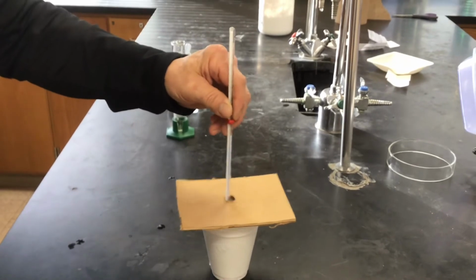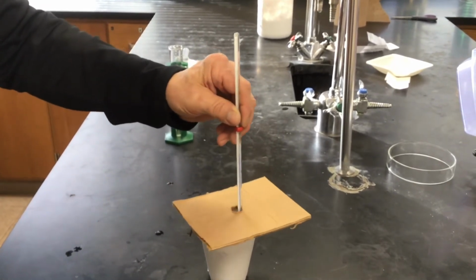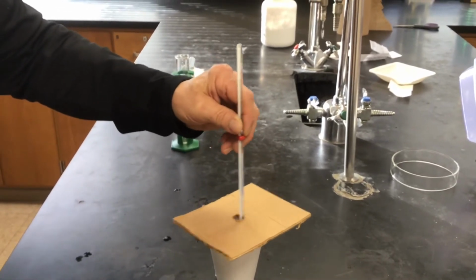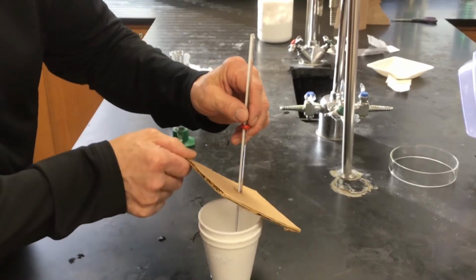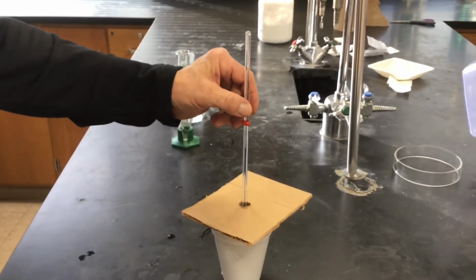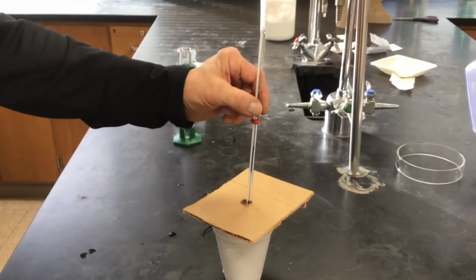Mr. Helvel's doing some gentle stirring in there just to keep that heat distributed evenly throughout the water. If you don't stir it, you can actually get hot spots in there. The bottom might be warmer, the top might be warmer, and you want it to be consistently distributed all the way through. Okay, I don't know if the temperature's done changing. I think it's all dissolved. Oh, looks like we've had quite a change.